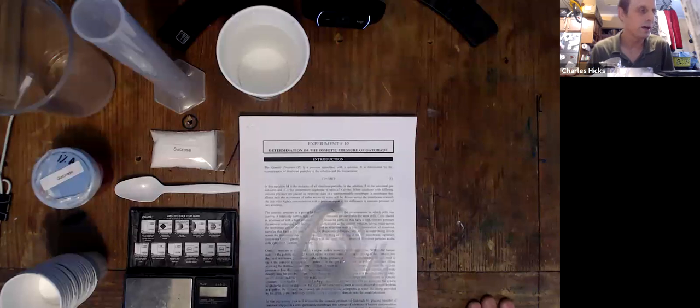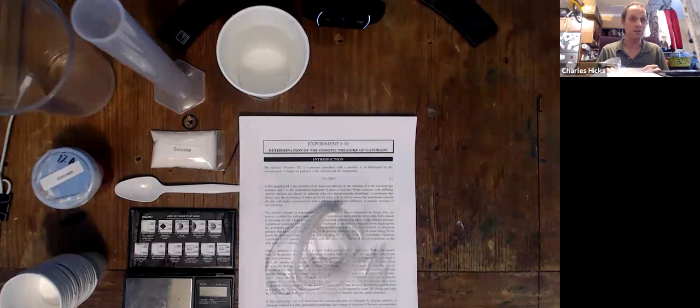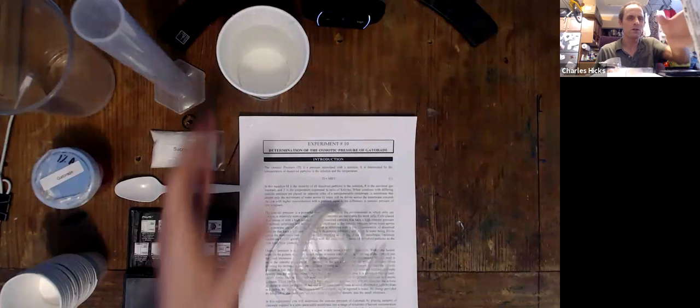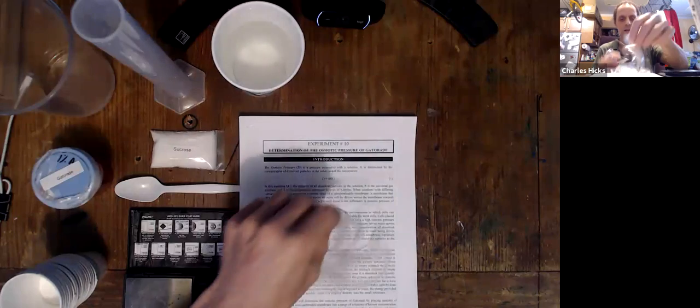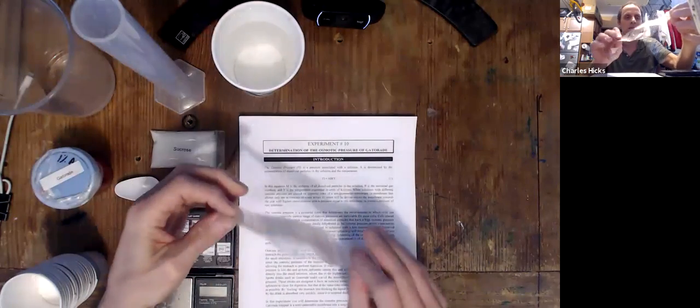So I have laid out here on the desk all the items from your kit that you're going to need to perform this experiment. I filled the large Dixie cup here up with fresh tap water, and this item is the dialysis tubing.